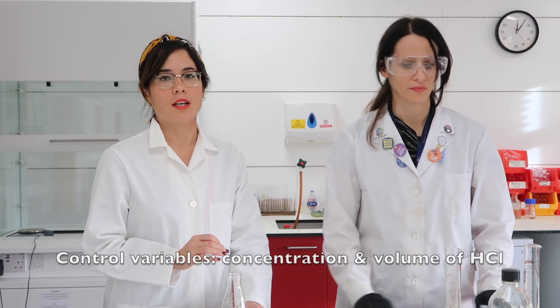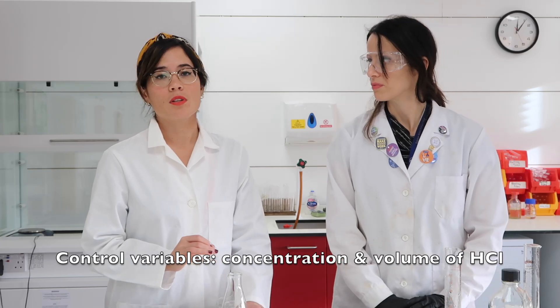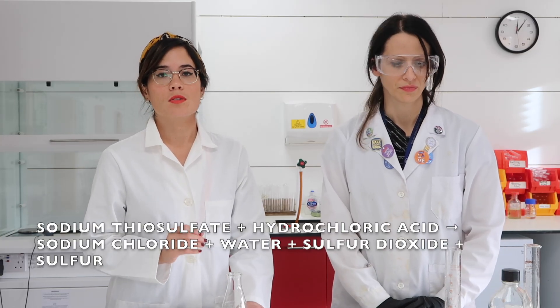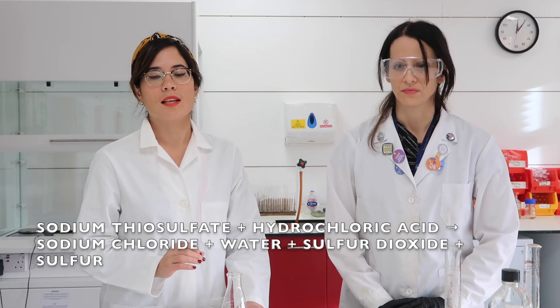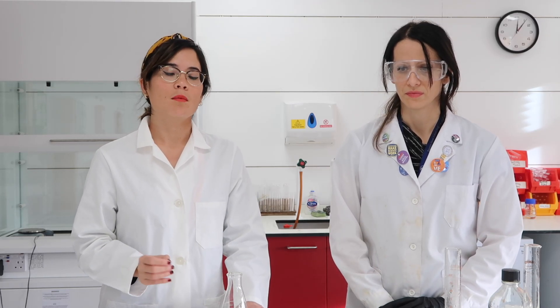We'll be adding the same volume and same concentration of hydrochloric acid each time. When the two reactants mix, you produce water, sodium chloride, sulfur dioxide, and sulfur. Sulfur is the important product here — it forms a precipitate, and it's that solid which actually obscures the cross. From a safety point of view, sulfur dioxide is pretty toxic, so we need to be careful not to inhale it or get it into our eyes.